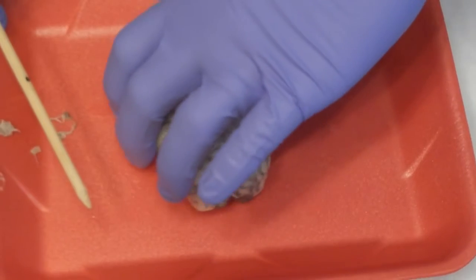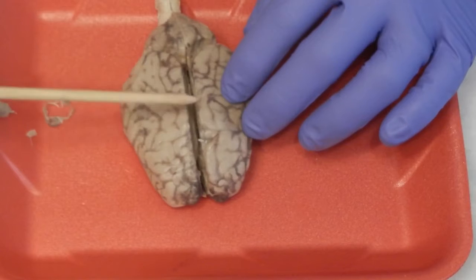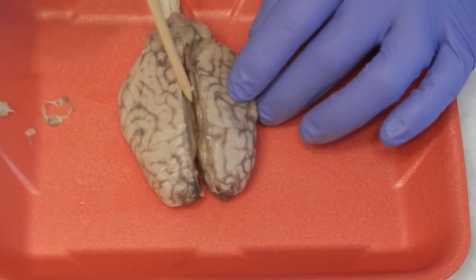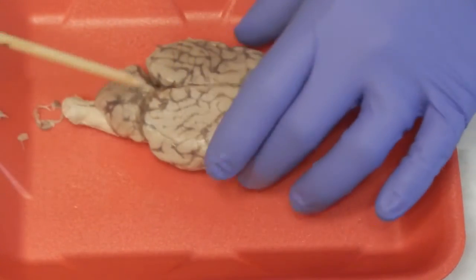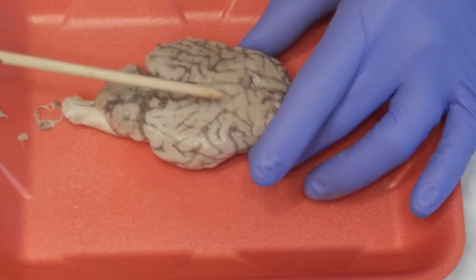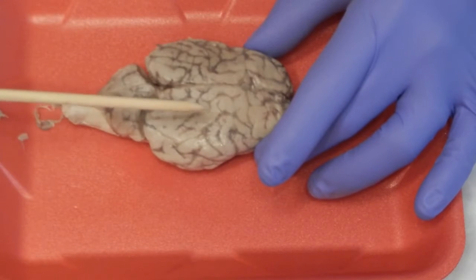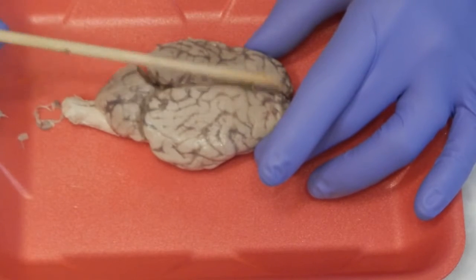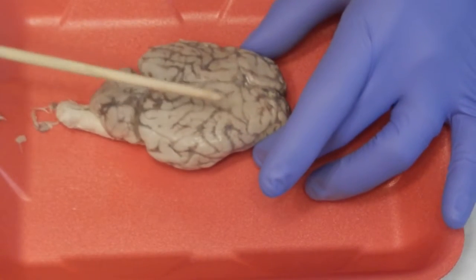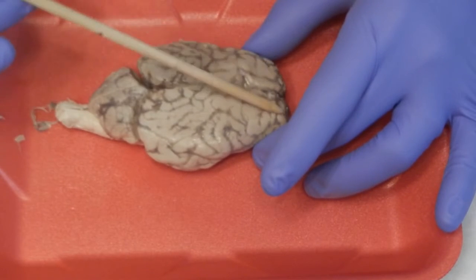Okay, so if we actually look at the brain itself, we see that there are two hemispheres which are separated by a longitudinal fissure and connected by the corpus callosum, which we'll get into a little bit later. When we see the certain sections of the brain, there are actually different lobes that we will see. Of course, we have the parietal lobe. Just like the skull, if you want to make reference to that, you have the parietal bone, the occipital bone, the frontal bone, and of course the temporal bone that's attached to the zygomatic bone. So what we have here is, of course, the frontal lobes of the brain.